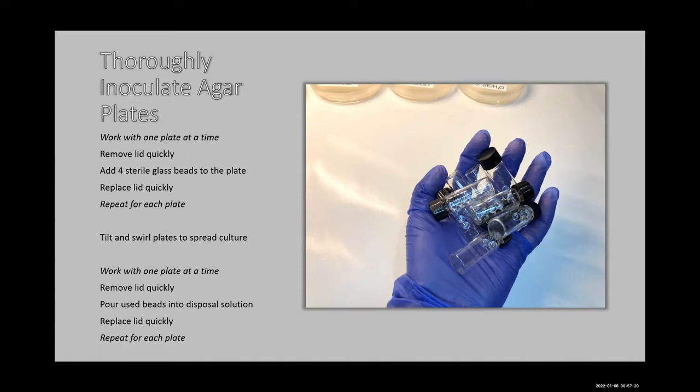And then, one plate at a time, we're going to remove the lid quickly, pour the beads into this disposal solution, and then replace the lid quickly. These glass beads have been heat sterilized.